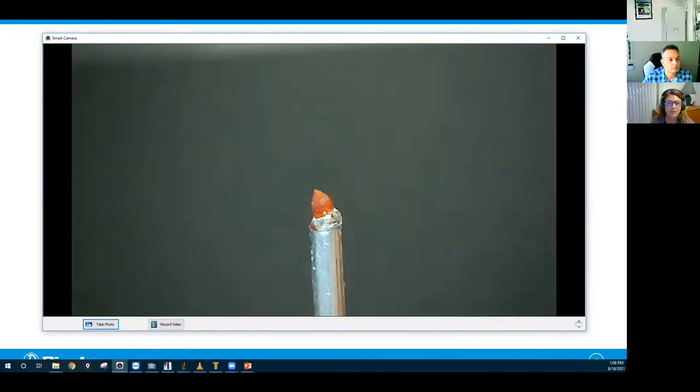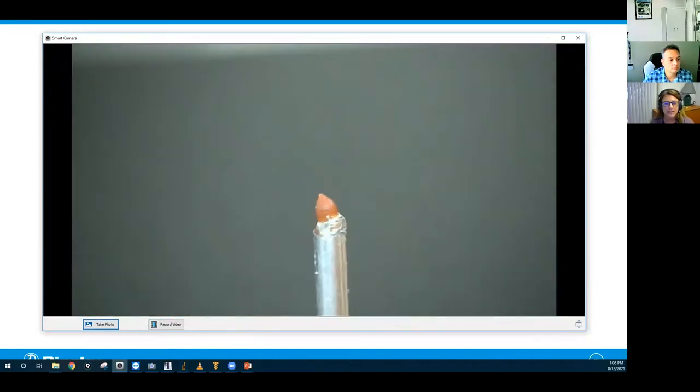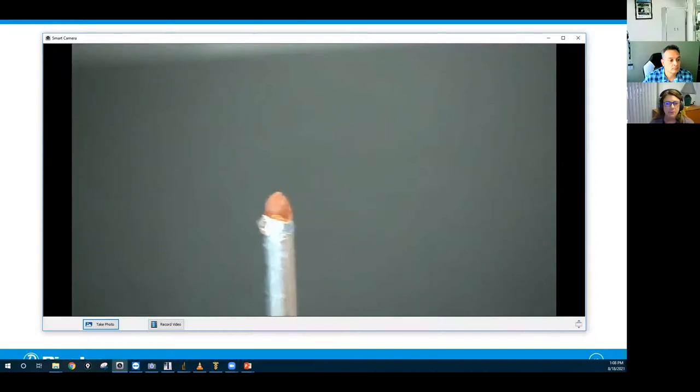Now this is a very small cranberry seed. It's sitting on a post of about a millimeter diameter. Your choices for this data collection are binning 2x2 800 projections, binning 3x3 400 projections, or binning 8x8 200 projections. So we'll give everybody a chance to vote. I have a lot of them coming in now. We'll see what we get.